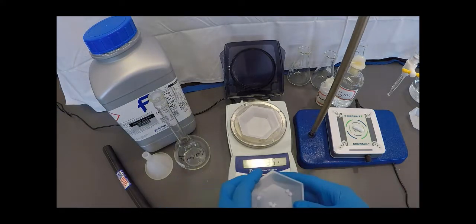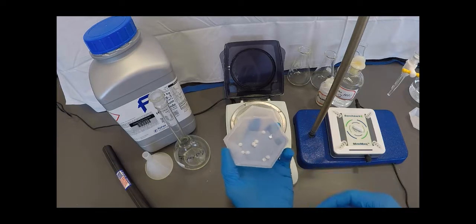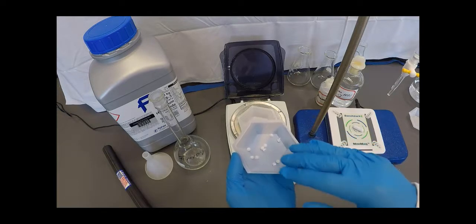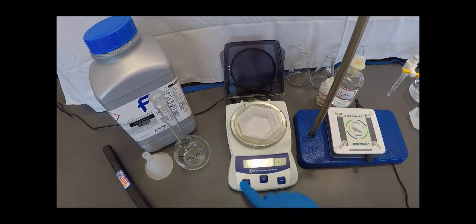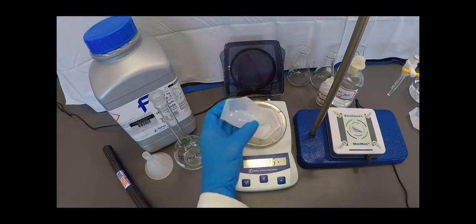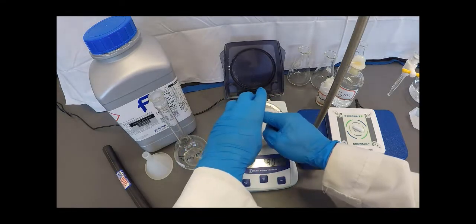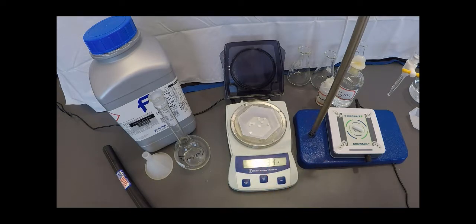So the first thing I'm going to do is I'm going to take my about one gram and you can see it's a little shiny and I just put this in here probably two minutes ago and I can already tell that it's taken up moisture from the air. So I'm going to zero my balance. So even try as I may to get exactly one gram, I'm not going to be able to do it.